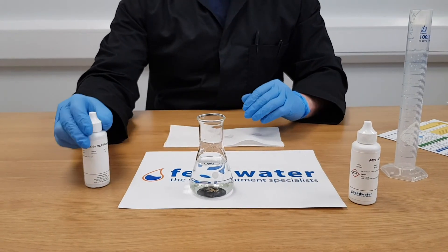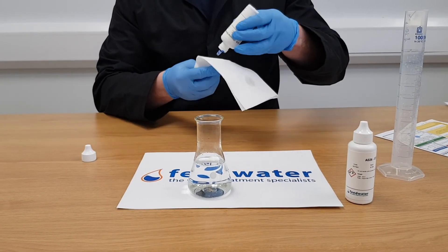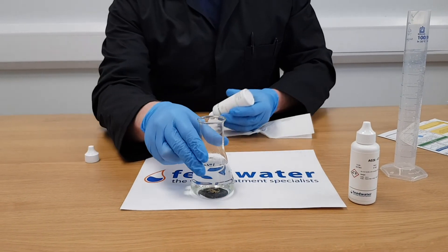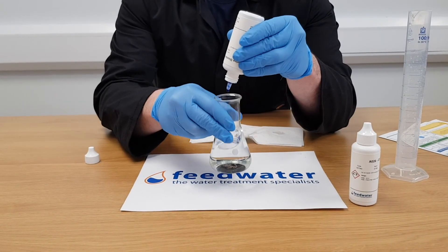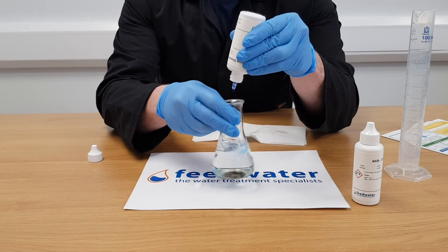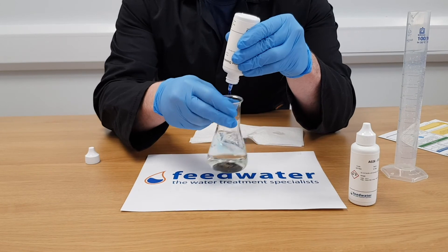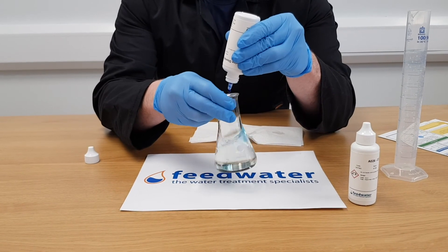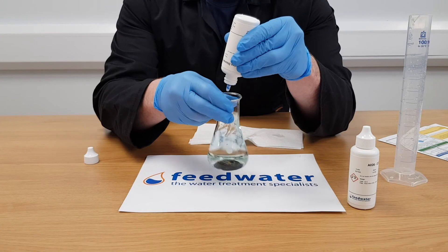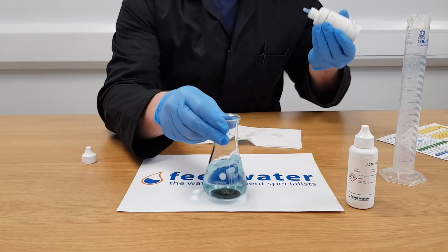Add one drop at a time of the VLR titrant and swirl to mix. Keep adding drops until the appearance of the first blue tinge, making sure to count the number of drops used. The end point is when the solution goes from clear and colourless to clear with a permanent blue tinge. This can be subtle so it is important to ensure that you carry out the test in good light, ideally with a light coloured or white background to check against.